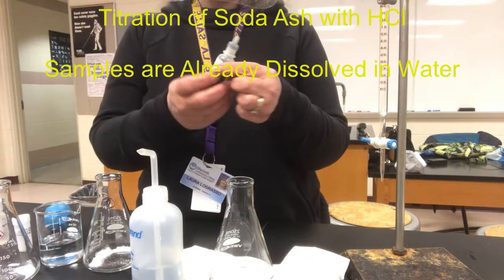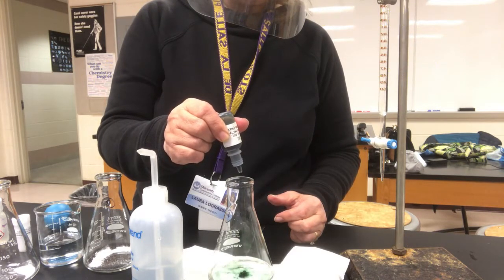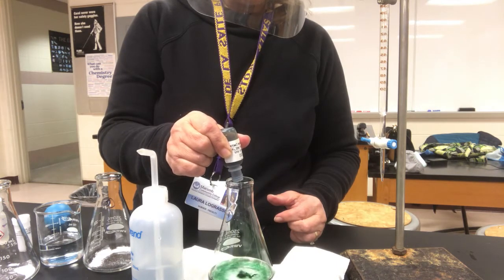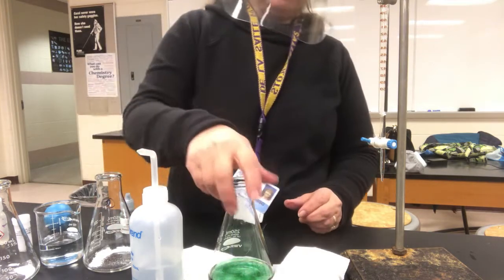So before we begin the titration, we'll add 10 drops of our indicator. 1, 2, 3, 4, 5, 6, 7, 8, 9, 10. Again, it's not super important that it be exact, nor is it super important that the 40 milliliters of water that we added be exact.